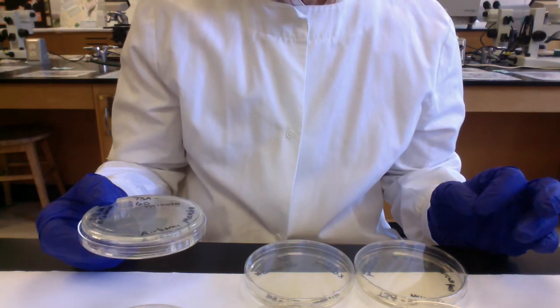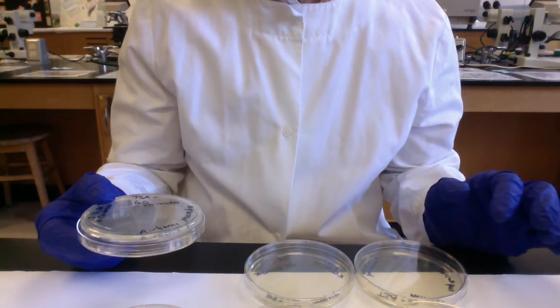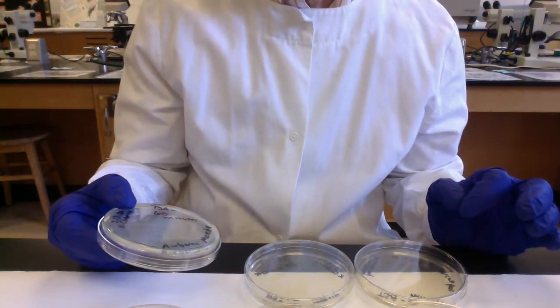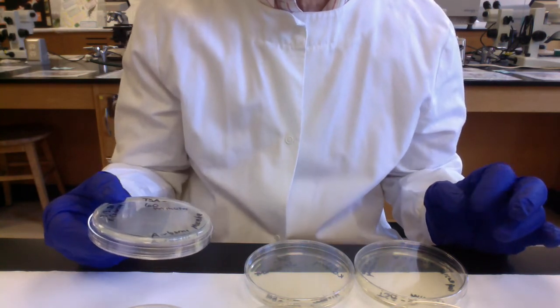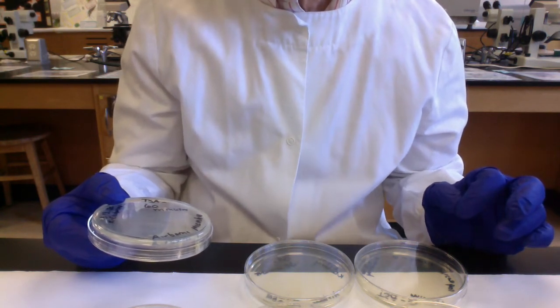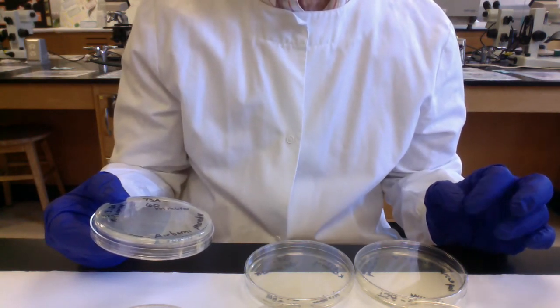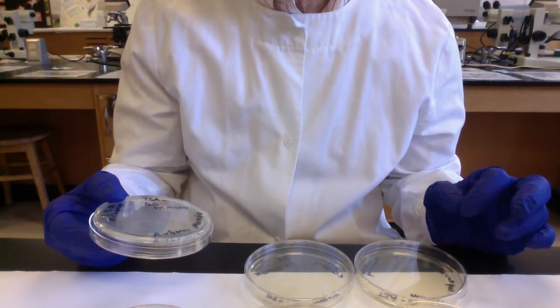In 48 hours, so today's Friday, so I'll be checking the plates on Sunday. We'll record what they look like at 48 hours, and then we're going to leave them for another week at room temperature. I guess I'll take them home with me, right? Because I can't come back into the lab. I'll keep them in our garage, and we'll see what they look like after. That would be, we'll check them a week from today. So we'll check again the plates at 7 days.